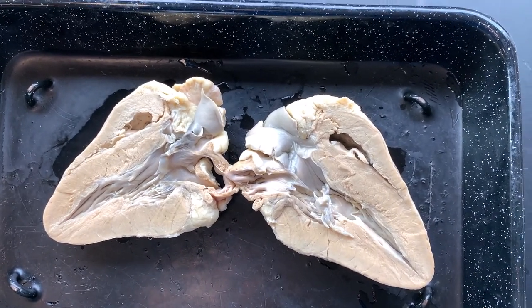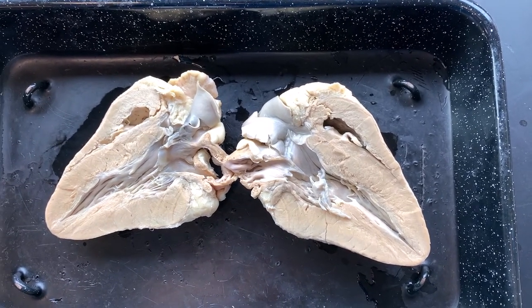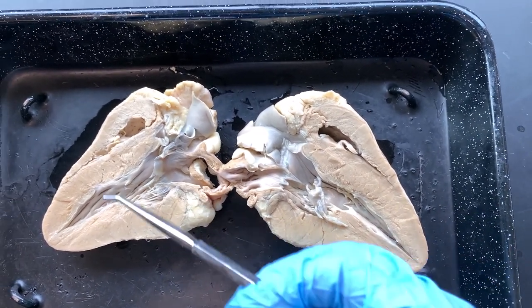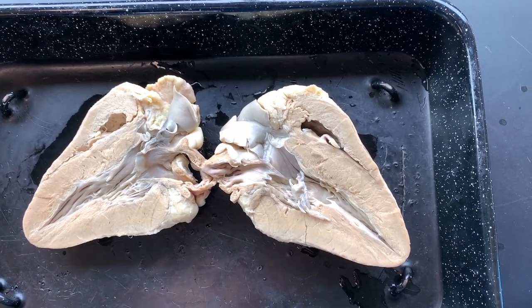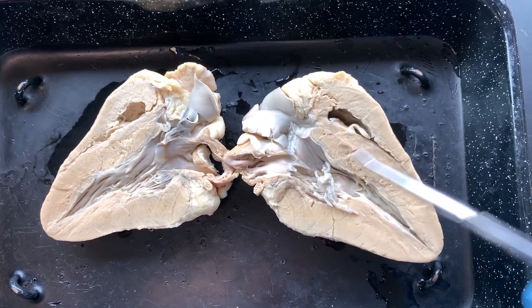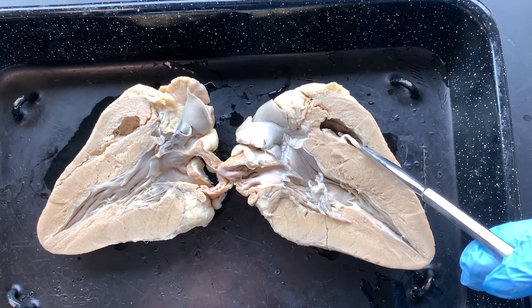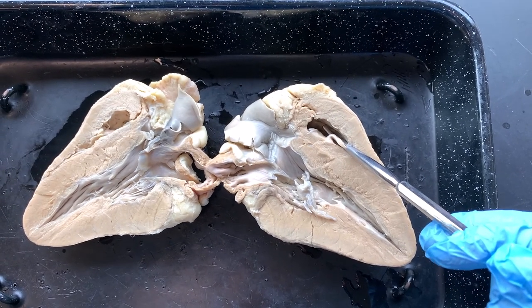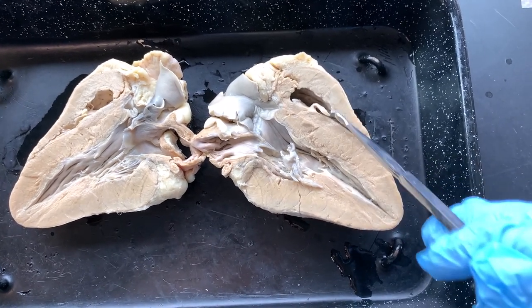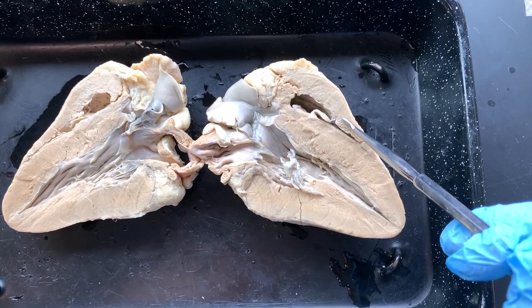If we're thinking about that, we need to think we're going to go to the small side of the heart first, or the smaller right ventricle. It's kind of hard because it's laid open like this. Use your common sense and say, which one of these cavities is smaller? The smaller cavity or room on a heart is going to be on the right side because that's the side with deoxygenated blood — it doesn't need to be as strong. This myocardium doesn't need to be as strong on the right side because this side only pumps to the lungs and the lungs are right next door.